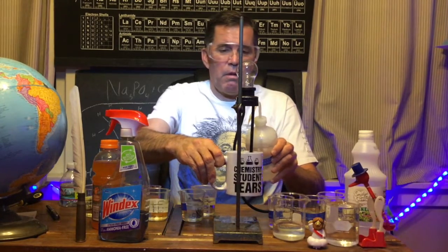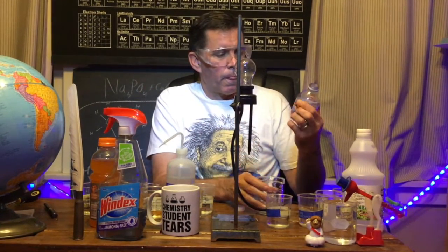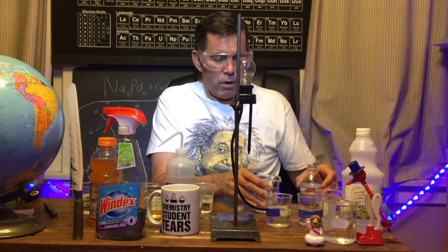So if you rinse your car with deionized water, you won't spot. Tap water has ions in it — maybe you think that's yucky. Well, what are the ions in tap water? Iron, calcium, magnesium — are those bad for you? No. But I know you'd rather pay extra money for bottled water. So let's see: the drinking water you buy at the store — does it have ions or not? Let's see — there are a few less than tap water. Even in Arrowhead there are some ions.